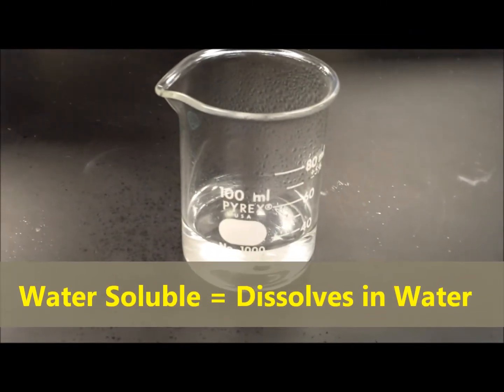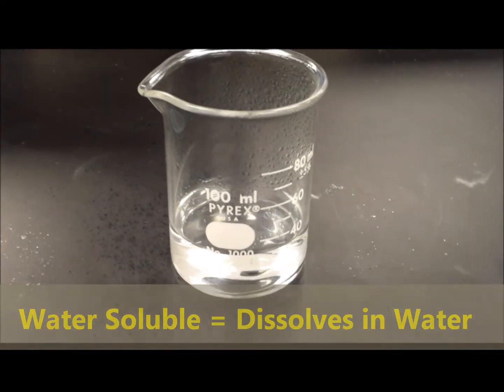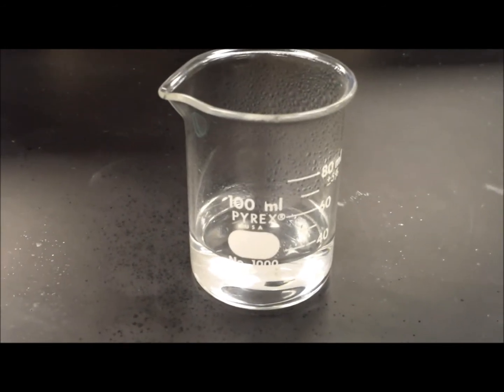So that hydrochloric acid that we're using is hydrogen chloride dissolved in water. The salt, magnesium chloride that forms, is going to be dissolved in the water. So we don't see it, but it's in there.